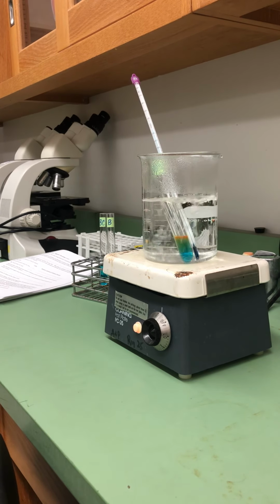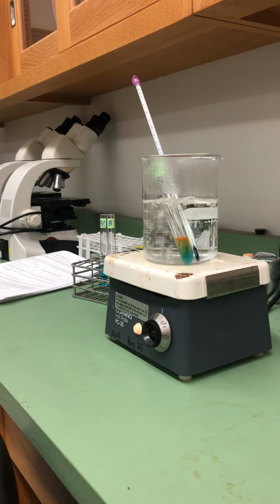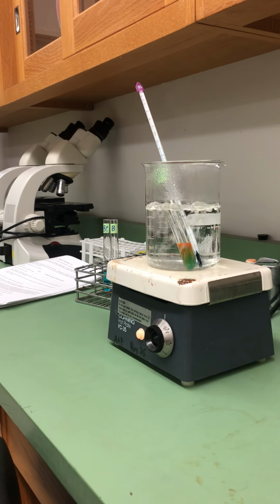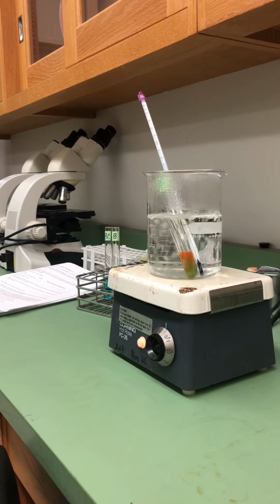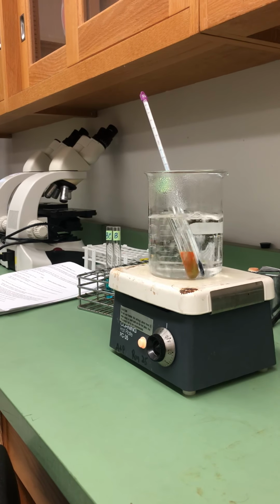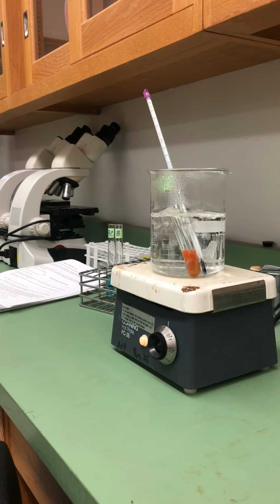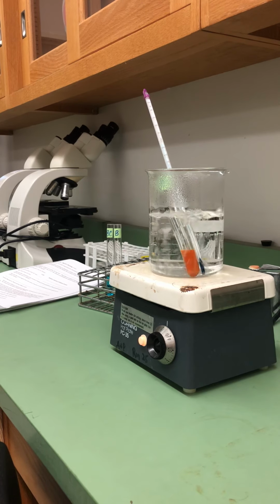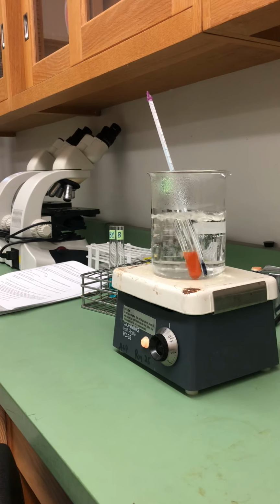As we watch the vial, we see a color change that runs through the entire tube. And it's at the surface where the precipitate is forming with the sugar, showing us the more dramatic change. So we see it changing from the blue color of the copper and the Benedict's reagent through a change of yellow to orange to deep red. It generally can take 10 minutes, but this is moving pretty fast. So we're already starting to see the full effect.